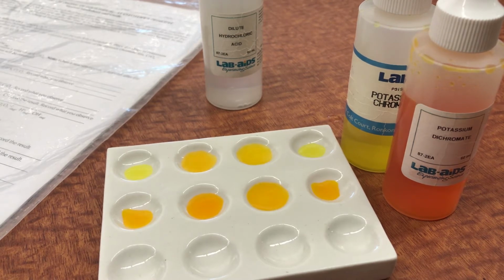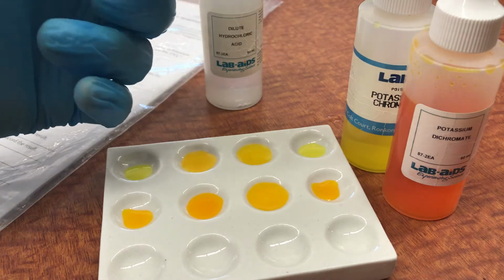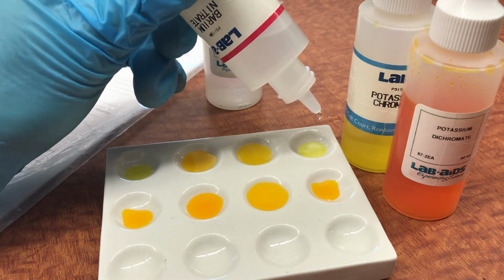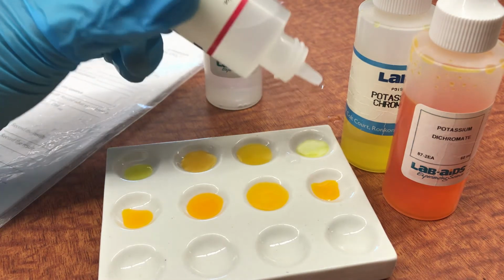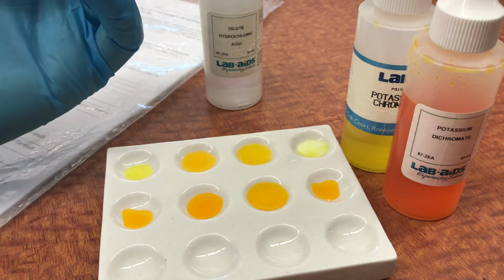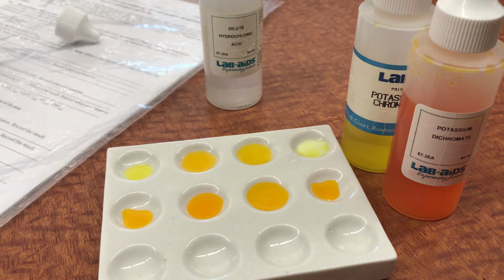Now, we can also force this chemical reaction to move in different ways if we create side reactions. So for example, barium nitrate has a reaction with chromate, so the yellow compound. Let's see what happens if we allow the barium to react with that chromate. We see the formation of a solid precipitate. So a solid precipitate forms. Now, that means that it's actually taken some potassium chromate and converted it into a solid form.